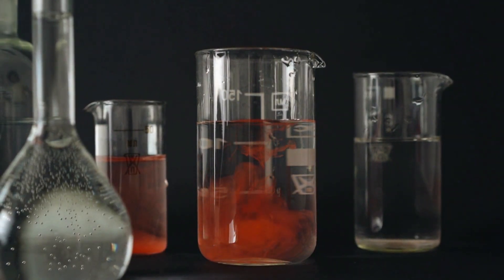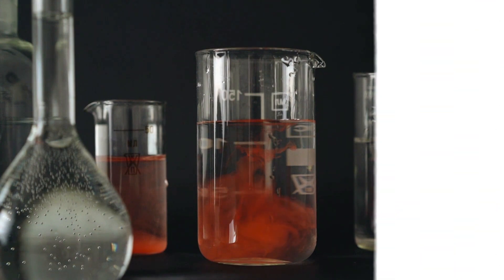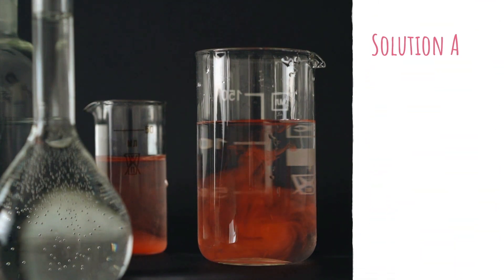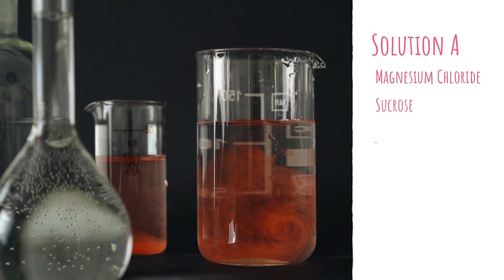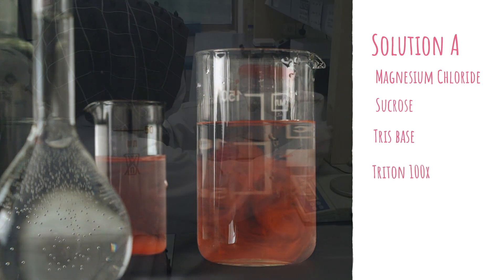So let's start with the formation of solution A. The reagents we require to perform this solution are magnesium chloride, sucrose, tris base, and Triton 100x.